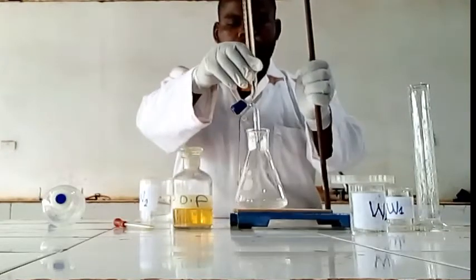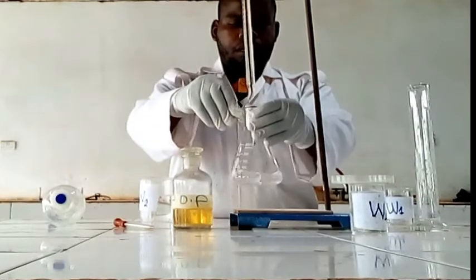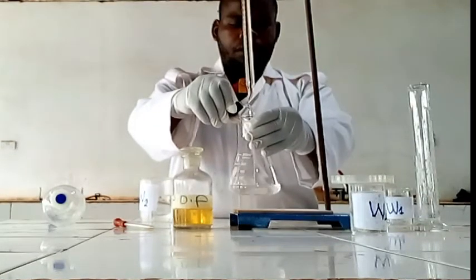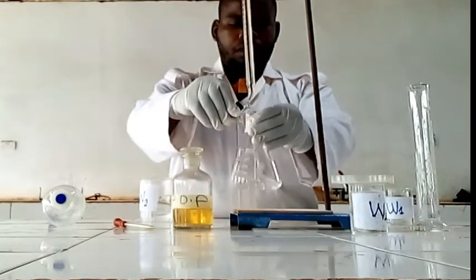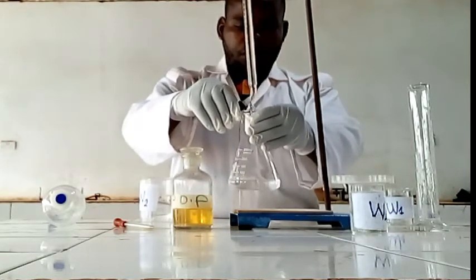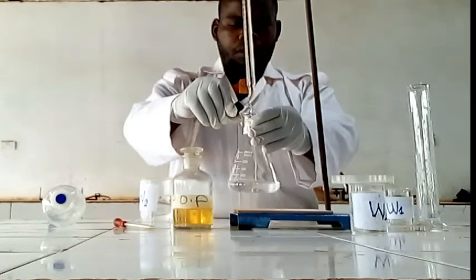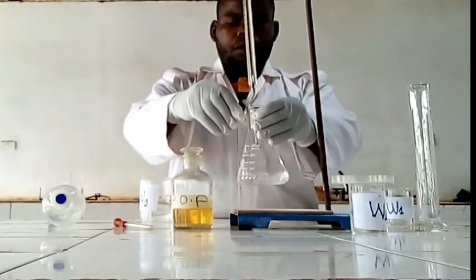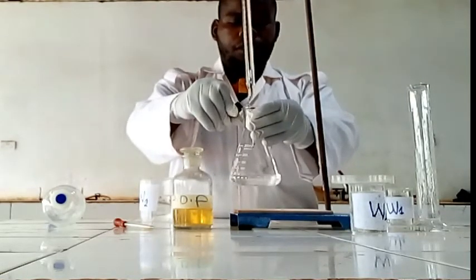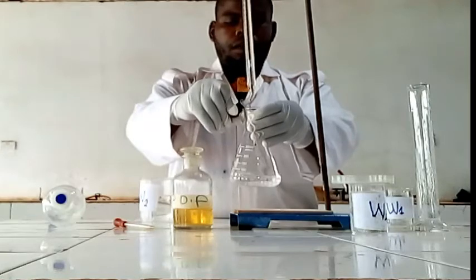You see the color change. That will be the end point for our reaction.